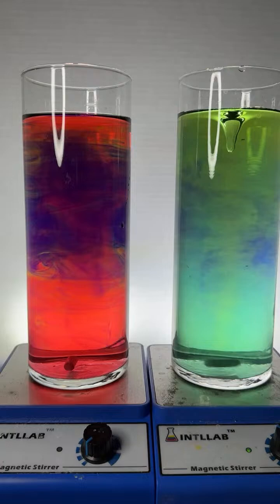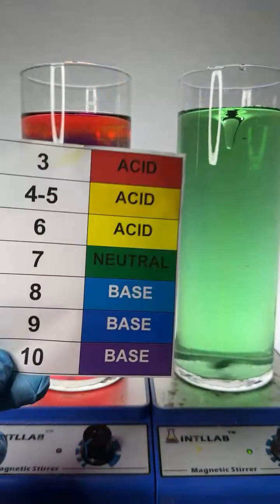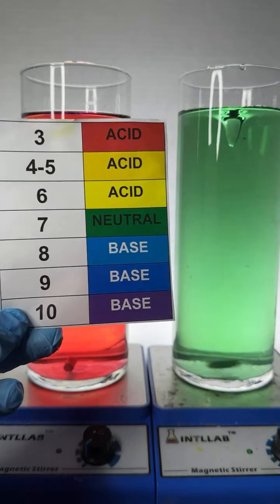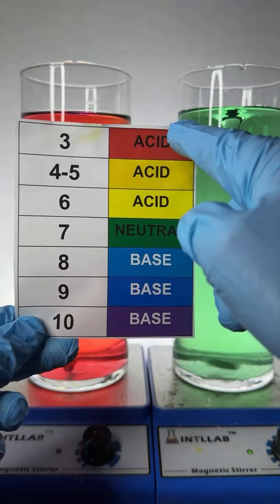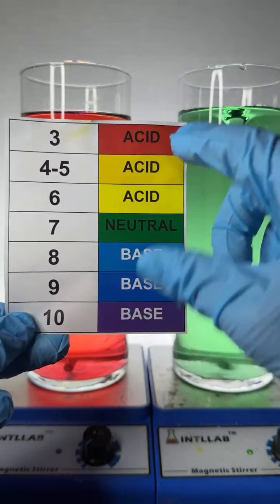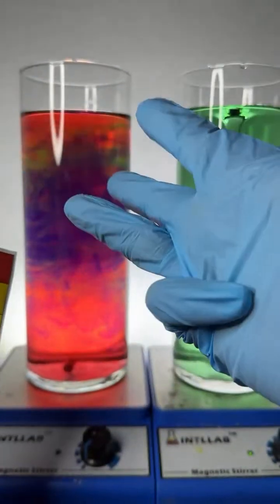And what's interesting is when you see red and violet in the same flask, you see a difference in pH of 7. You're like, well, so what? So the pH difference is 7. Well, the pH scale runs on powers of 10. And because of that, the difference in acidity between pH 3 and pH 10 is a difference of 10 times 10, 7 times. What's 10 times 10, 7 times? So that's 10, 100, 1,000, 10,000, 100,000.